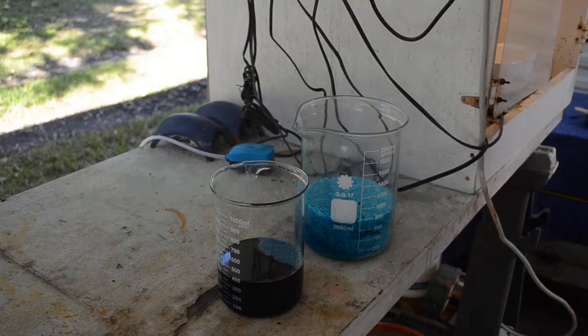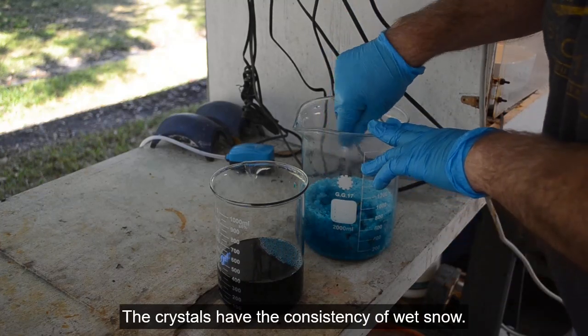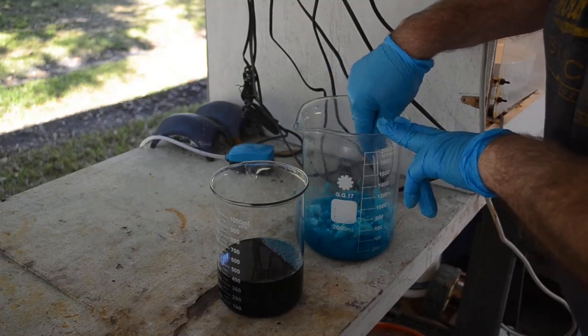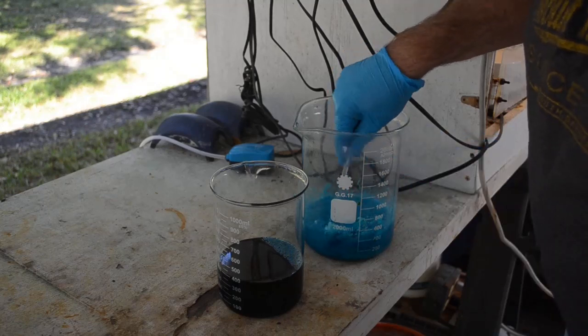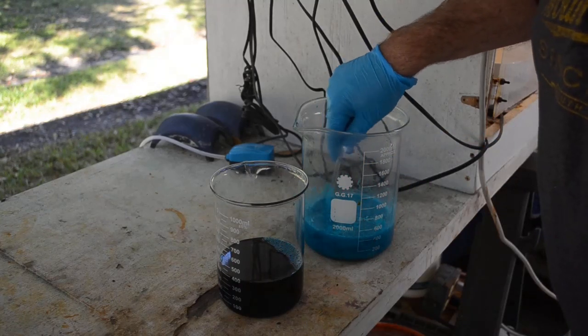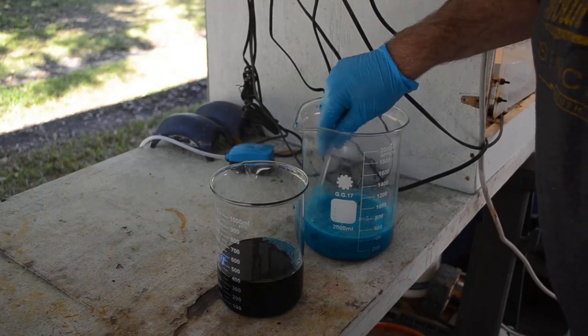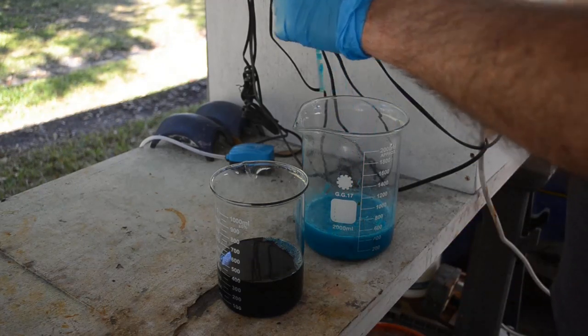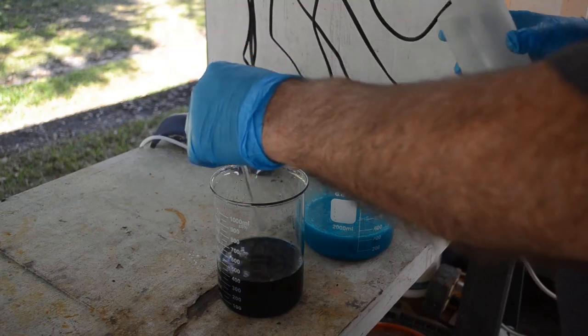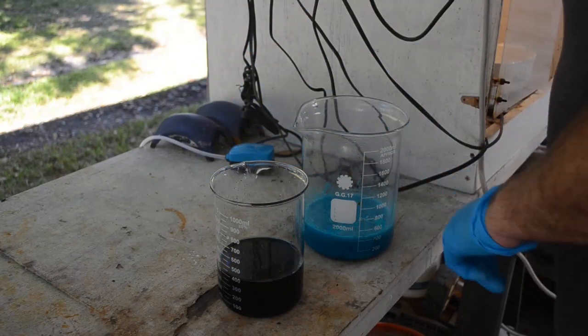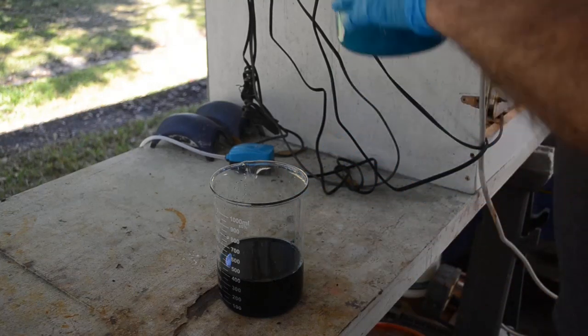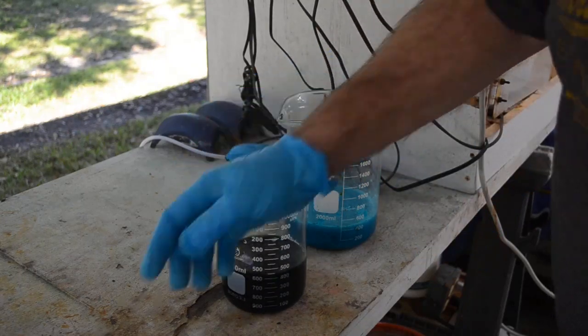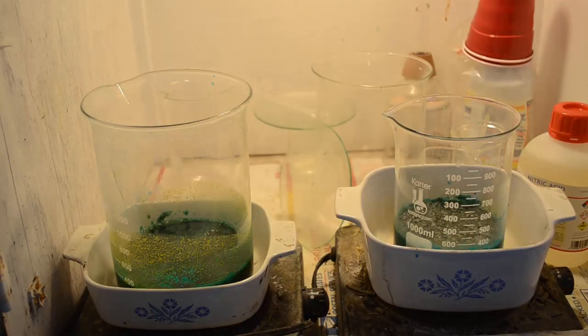Let me see how consolidated this is. Oh, it's not consolidated at all. Okay. Maybe I can get the water to separate, or the liquid to separate from the crystals a little bit better if I do this. I don't want to put any water in there. I'll clean off my stir rod over here. I'll let that sit and see if it'll settle. And, I'm going to put this on to low heat and let it continue to evaporate.